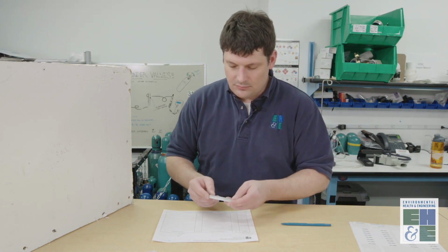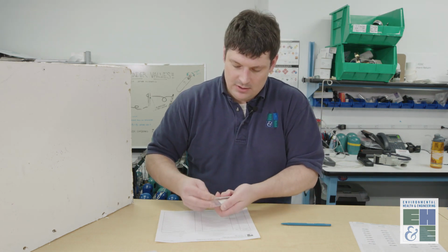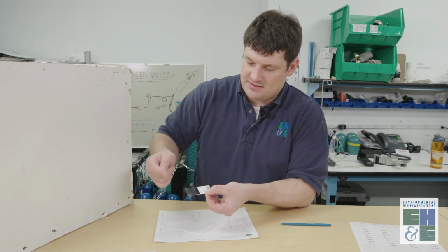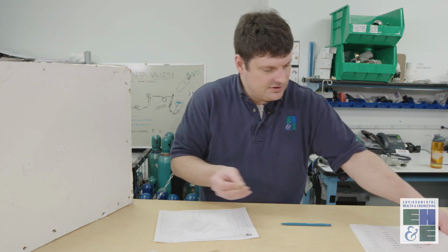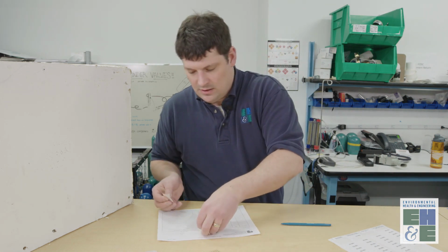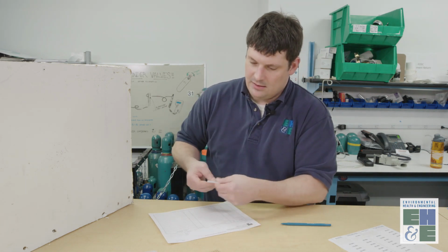Typically we also collect field blanks in this sampling protocol. To do that, you take another slide, making sure that the top is up, open it, making sure not to touch the sticky portion, remove the covering, put a sample ID on the slide, return it to the case, the top up, and now you've collected your samples.